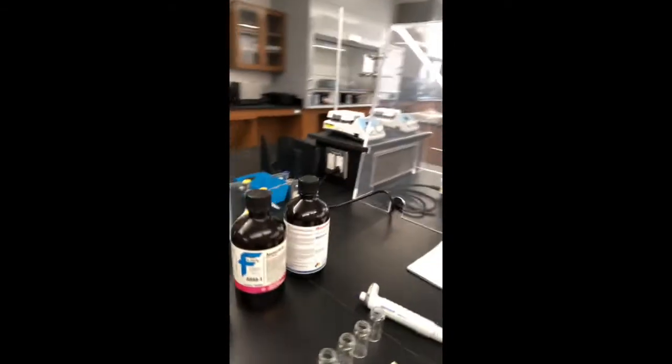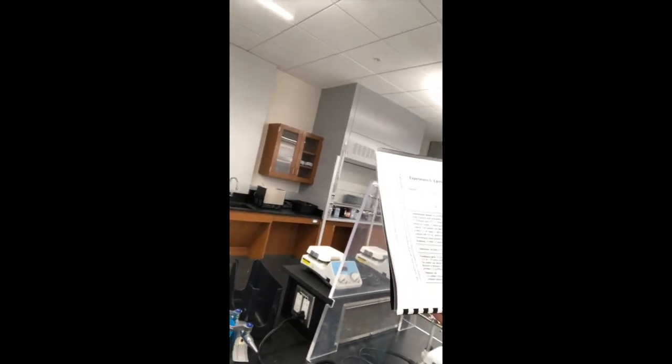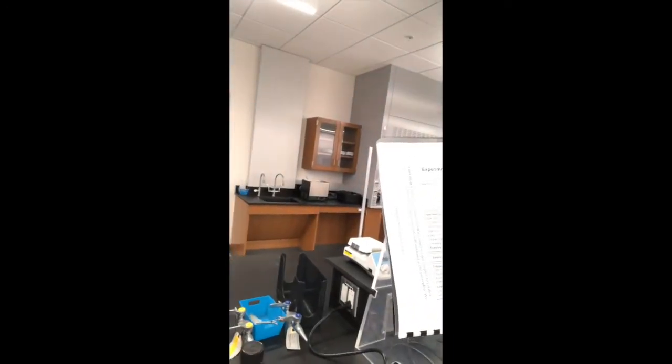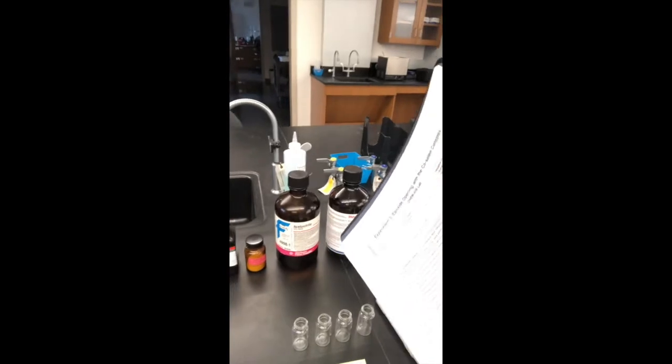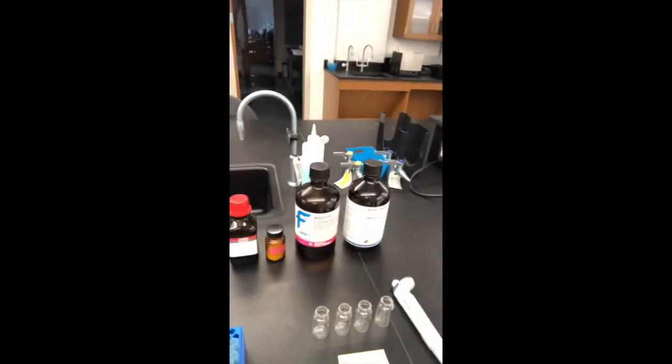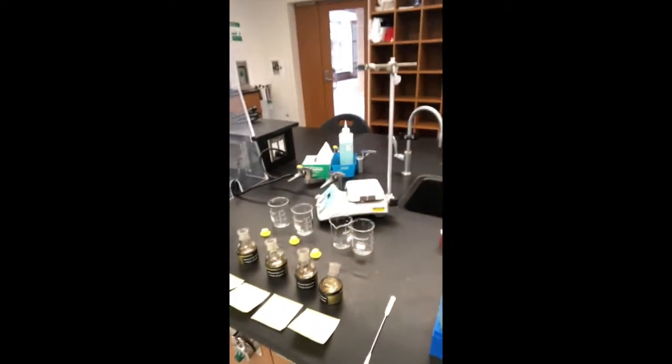So next, if you read the procedure, you'll see that we're supposed to add a mixture of methanol, styrene oxide, and acetonitrile to the cobalt complex and LPTS in an ice bath. So the next thing I'm going to do is mix the styrene oxide, the methanol, and the acetonitrile into each of these 4 vials. I'll make 4 identical vials, and then I will just cool down the round bottoms in ice baths, which we've got right there, and then we will cap them, let them run for a week. So that's the plan.